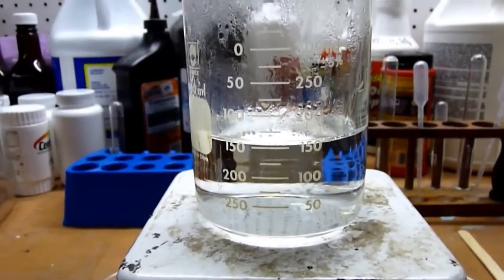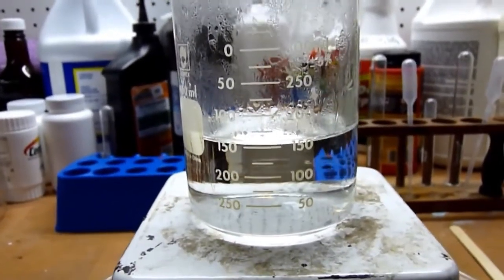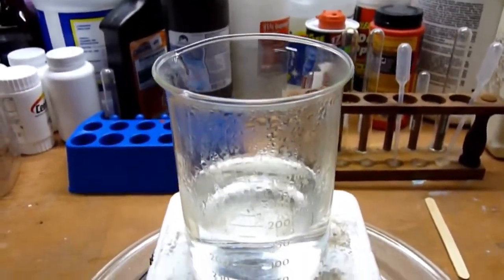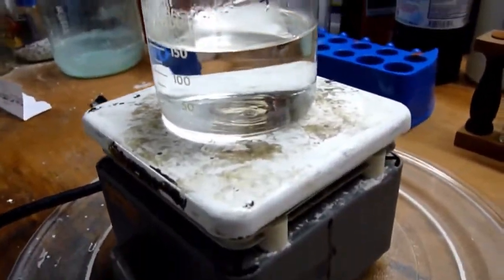Okay, here we are, an hour and a half later. And as you can see, the 250 milliliters we put in is now down to about 150 milliliters. This is steaming at about the rate it needs to be. It's probably difficult to see because I don't have a dark background, but it's just basically a steaming cup of water. That's what it looks like.